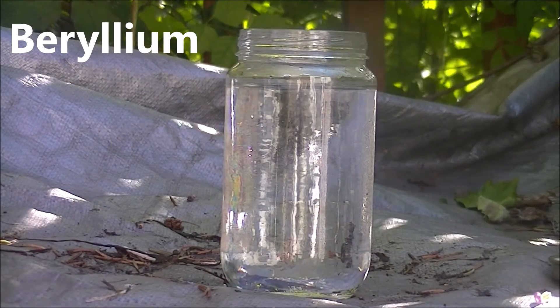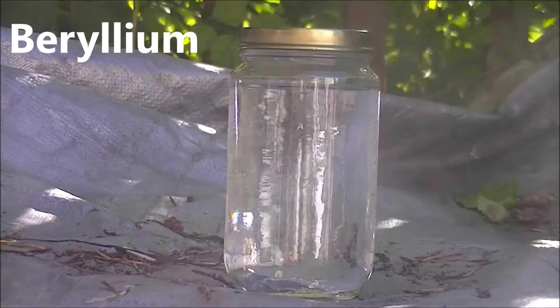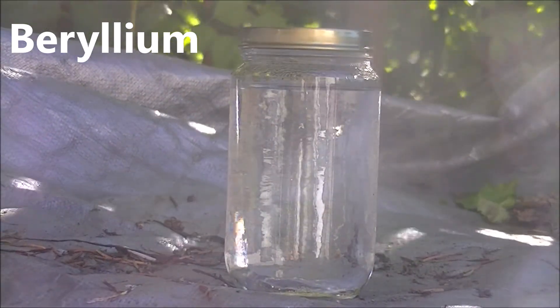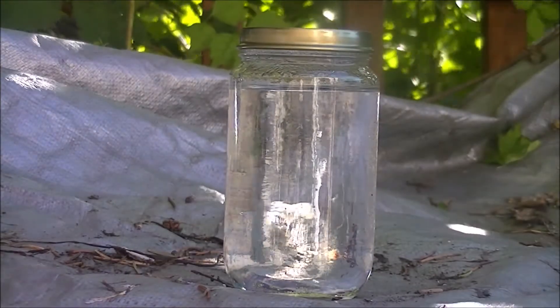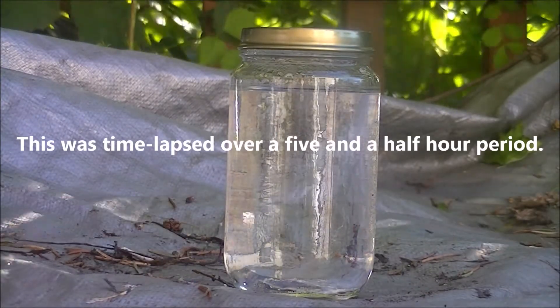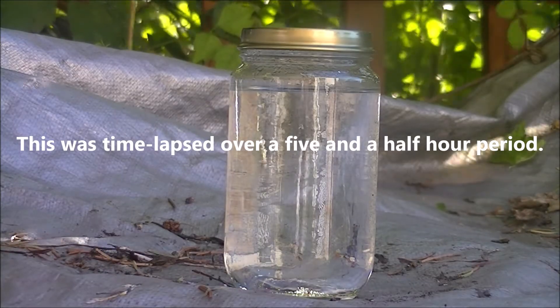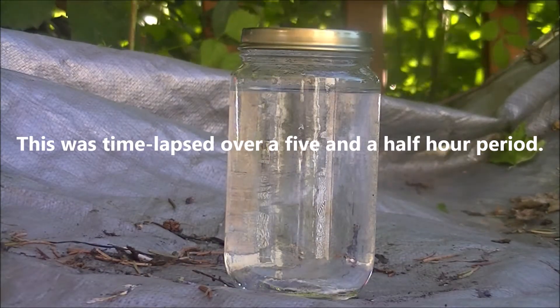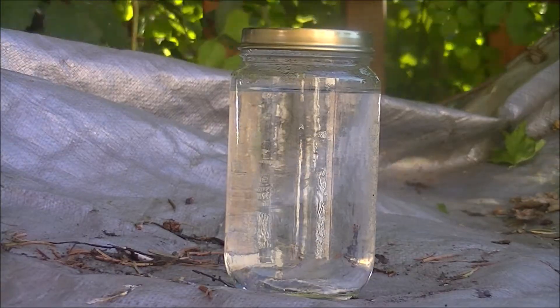First, we have beryllium, which does not react with water and is incredibly toxic. Inhalation of beryllium particles can lead to berylliosis, so handle with extreme care and only use it if you have the proper safety equipment.